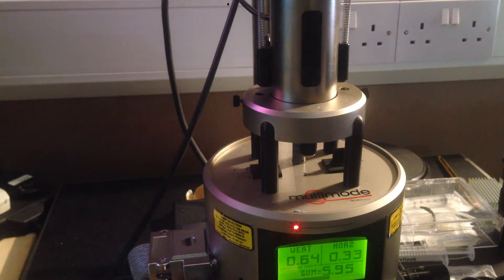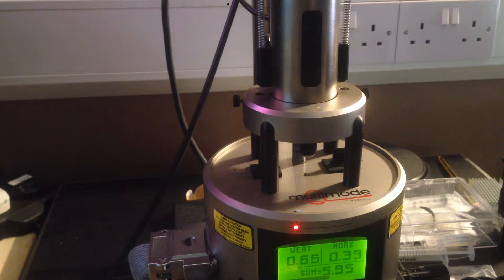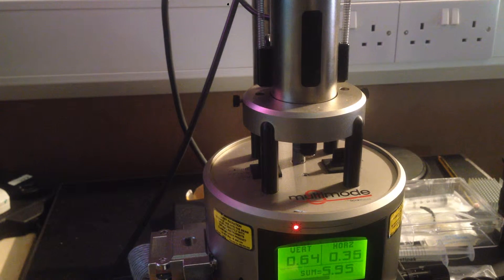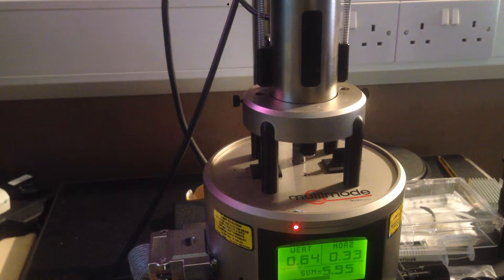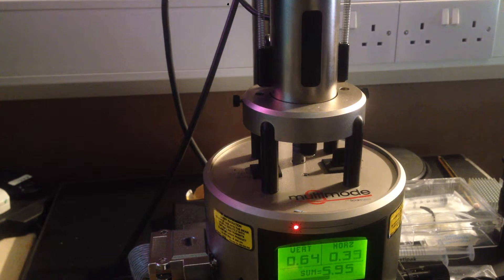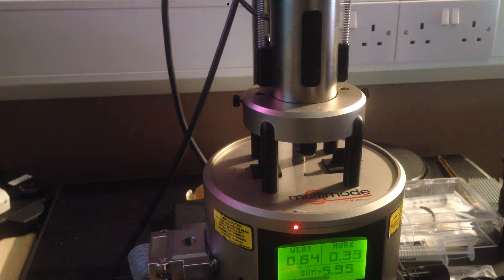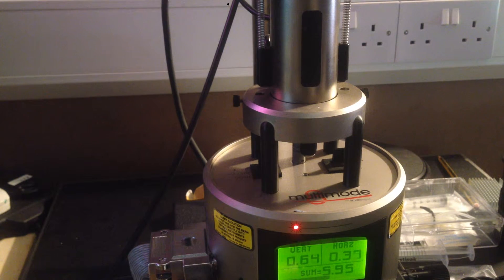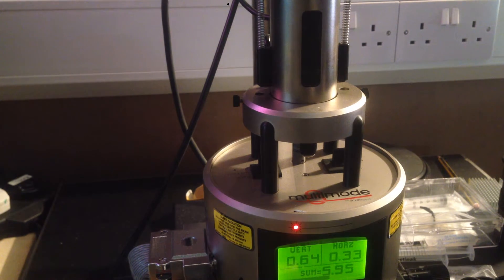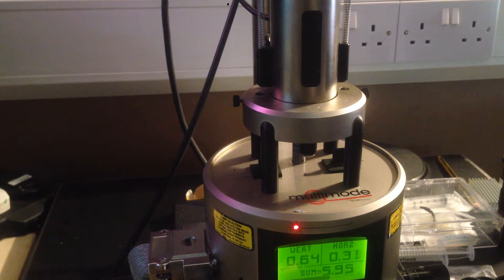To me it's completely non-intuitive. Down means move it towards the cantilever, so the stage is going up. And up means move it away from the cantilever, so the stage is going down. So it's the opposite of what I would expect.